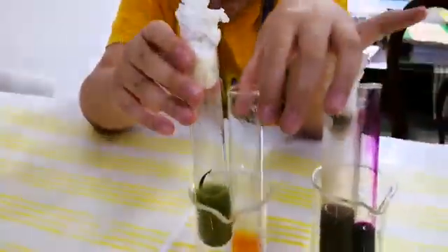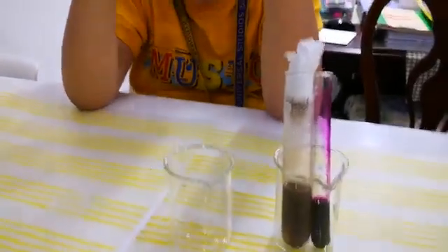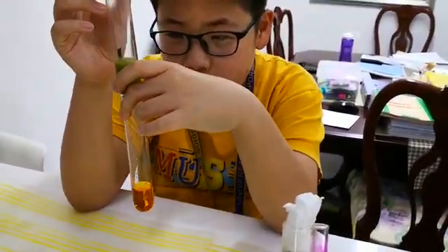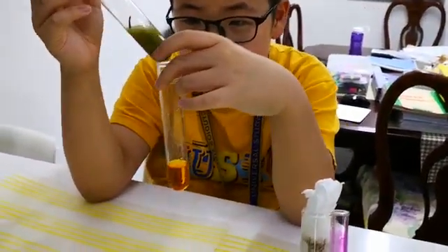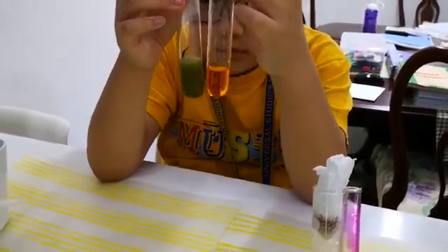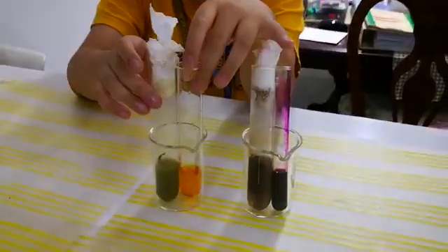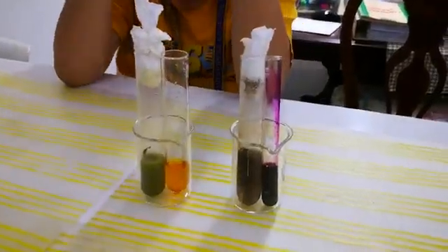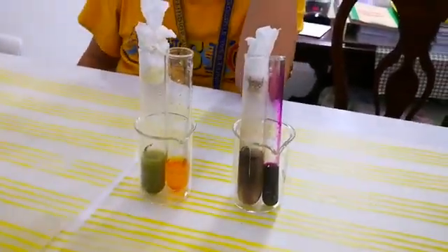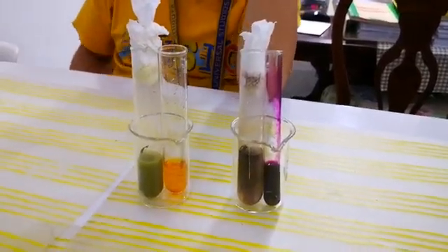On the right we have potassium dichromate, which is what color? Orange. So when we react with nascent hydrogen, it turns into a green solution.